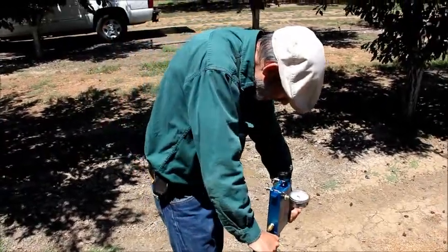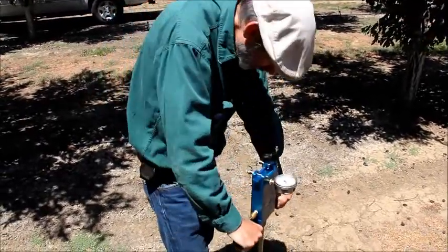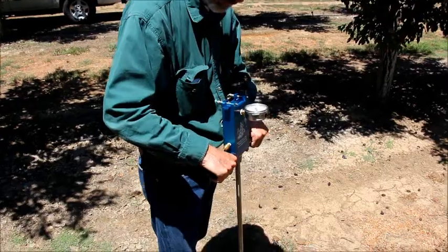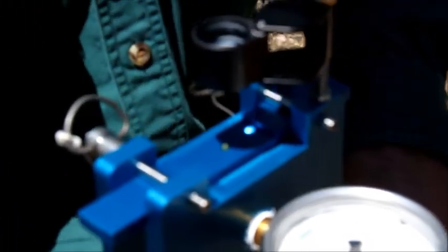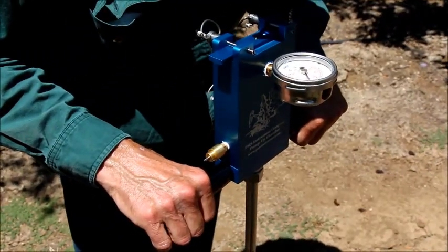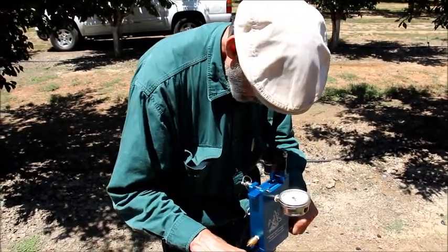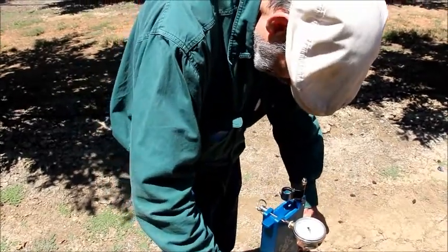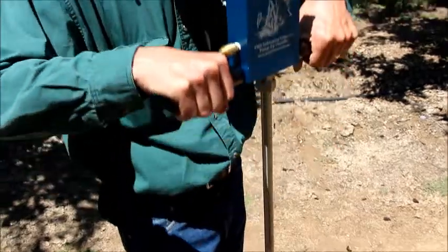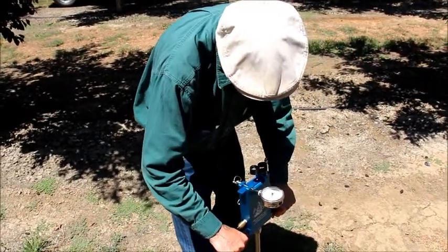If you look at this now, you'll see it's just as dry as when we put it in — no water coming out yet. It's usually pretty obvious once you start seeing the water come out; most people would say 'oh yeah, there's water coming out' — it doesn't take a lot of training. There it is — okay, so that's at 14.6. If you want to check, you can let a little bit of pressure off and that water should go right back inside. I took it from 14.6 to about 13.6 and the water went back in. You can start pumping again and you should get about the same number — sometimes the second one is a little bit higher, but usually not by much. This is about 15.